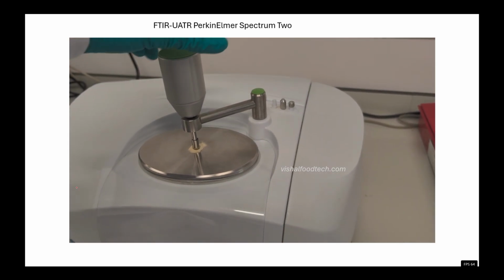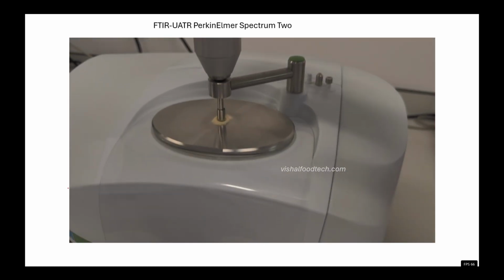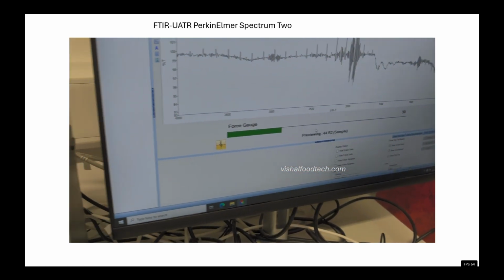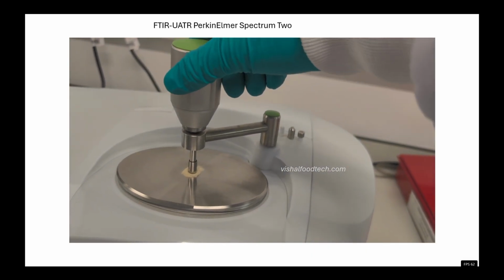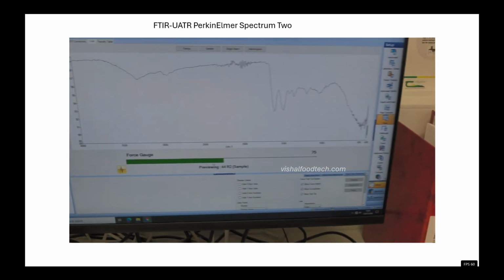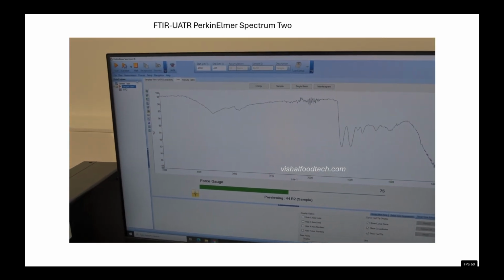So our target should be 75% of the force gauge. We will rotate the knob until the force gauge reaches 75%. Currently it is 39%, so we'll rotate more in the clockwise direction, and then we can see here it has reached 75, not percentage.